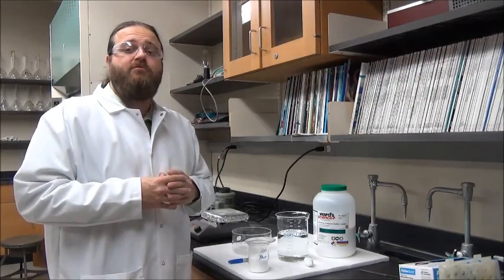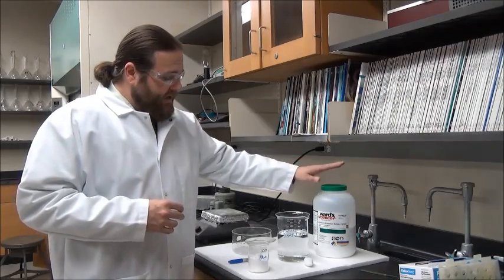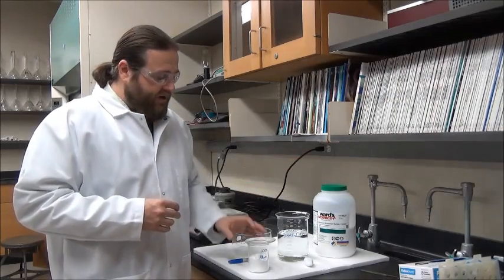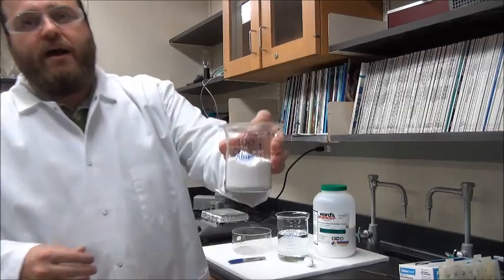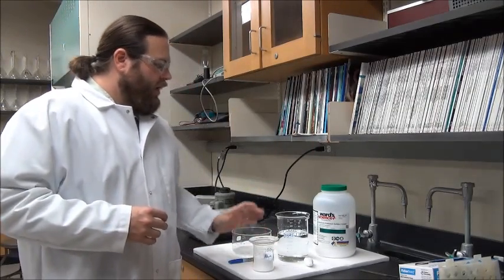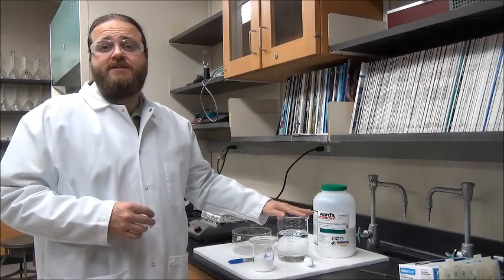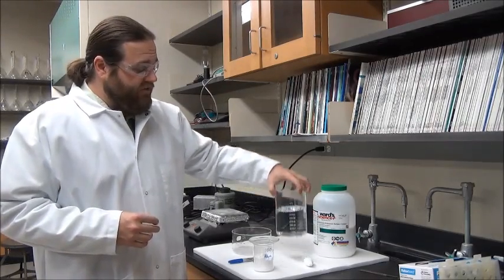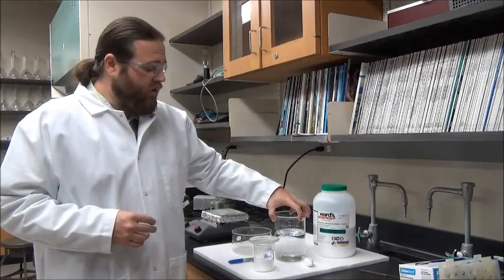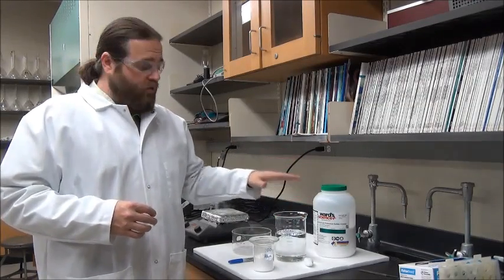This competition uses 100 grams of potassium aluminum sulfate dodecahydrate, and that's this container right here. We've gone ahead and weighed out 100 grams of the material. We also have a Pyrex beaker that is safe to heat, full of 700 milliliters of distilled water.